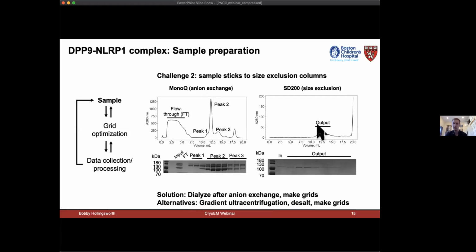And essentially the protein never comes off of the column. It's either getting stuck in the filter or on the column support itself. And so this was throwing us for a loop for some time, but I just went back and did negative stain of this peak and it looked gorgeous.